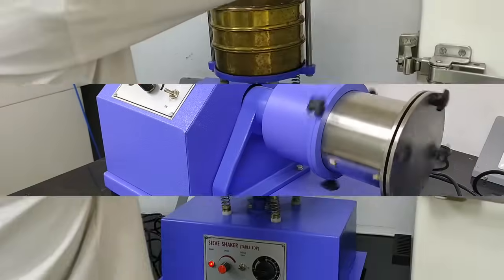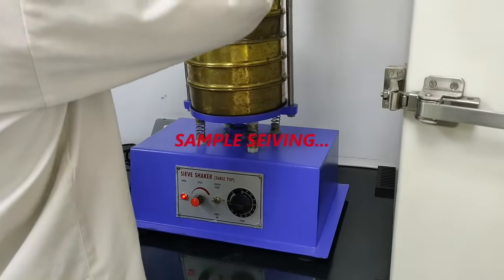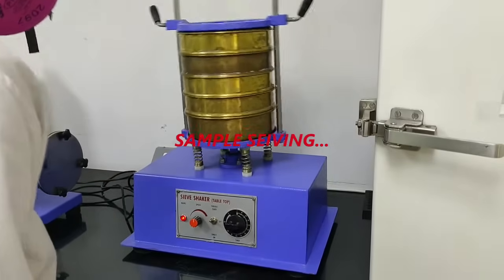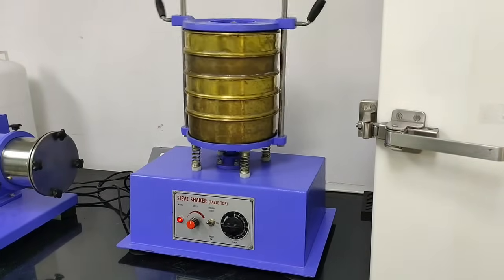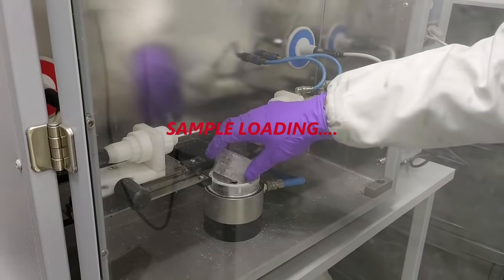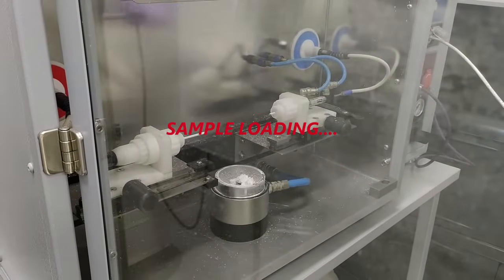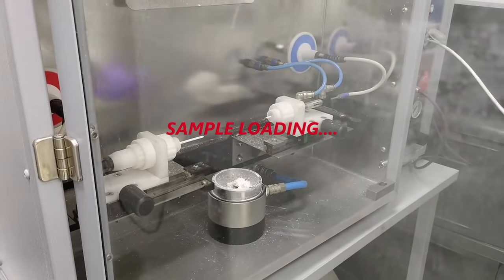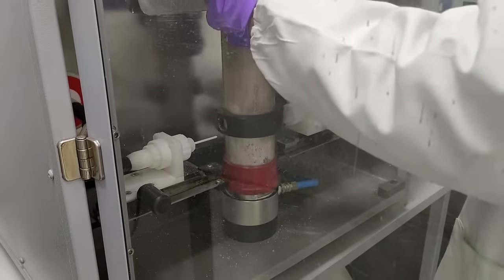The sample is then loaded into the sample chamber present in the minimum ignition energy equipment. Various energies are applied at constant pressure for samples of different concentrations, and as the sample cloud gets dispersed in the hartmann tube, the spark generated from the electrodes causes ignition.